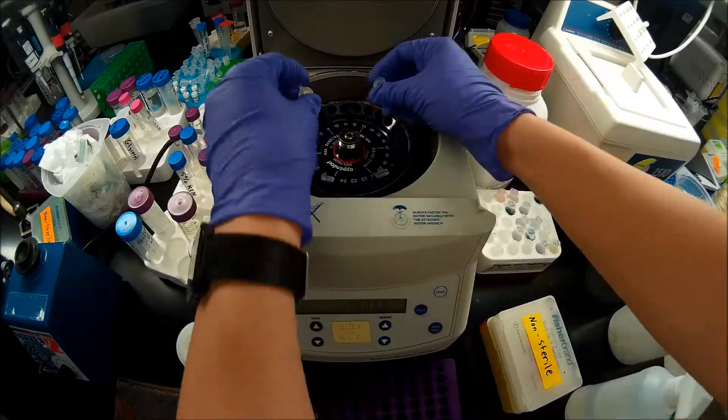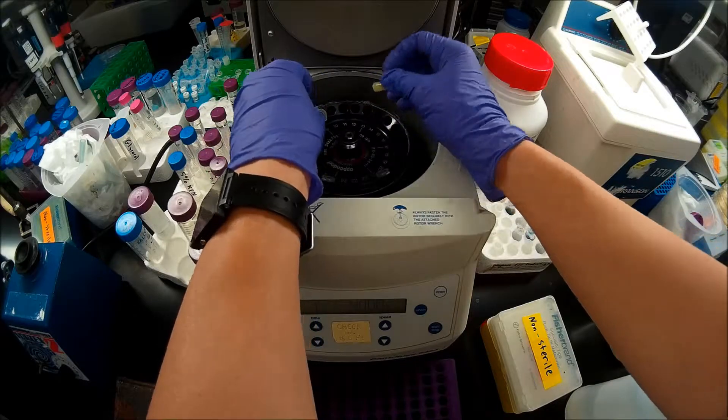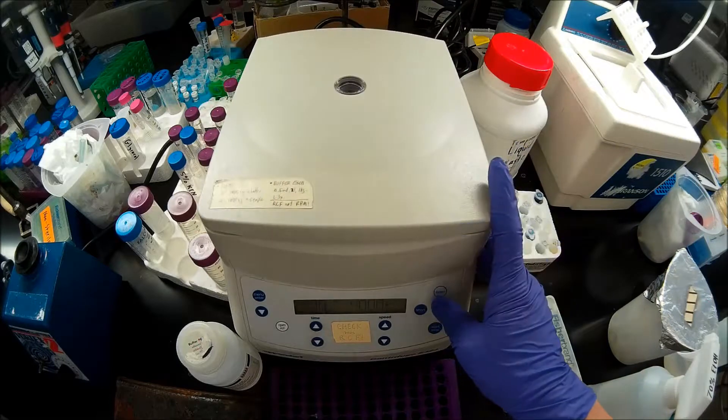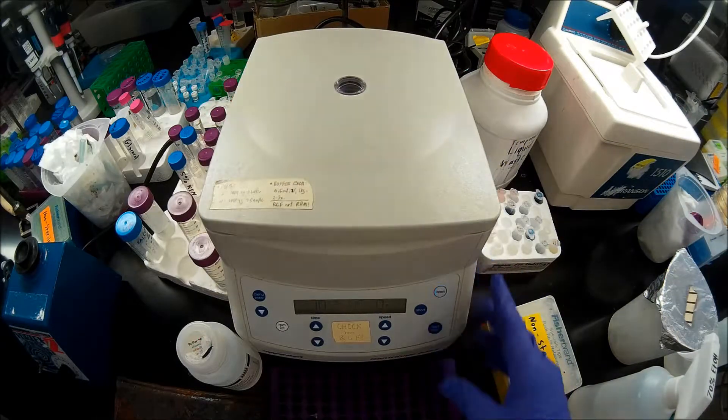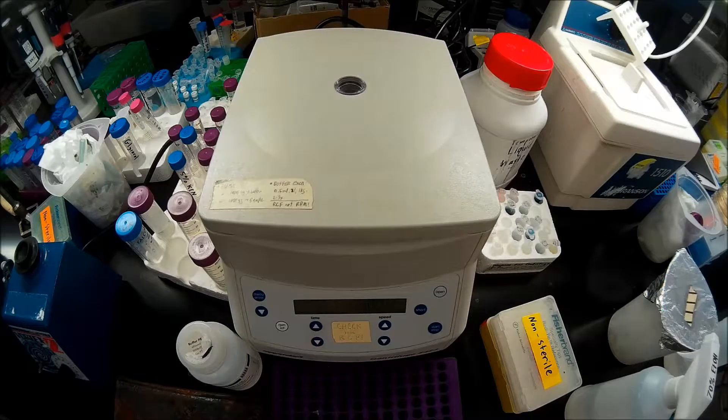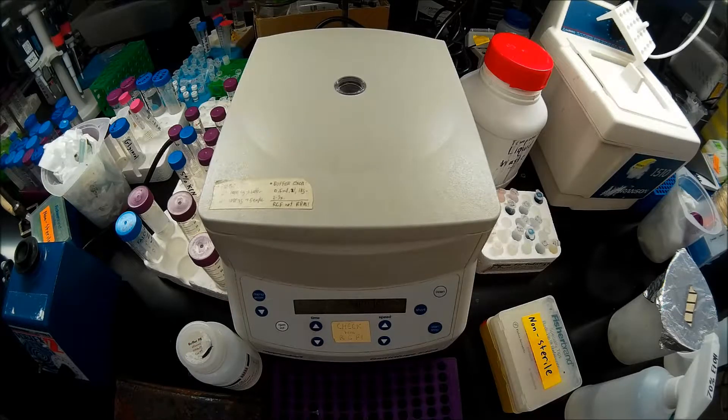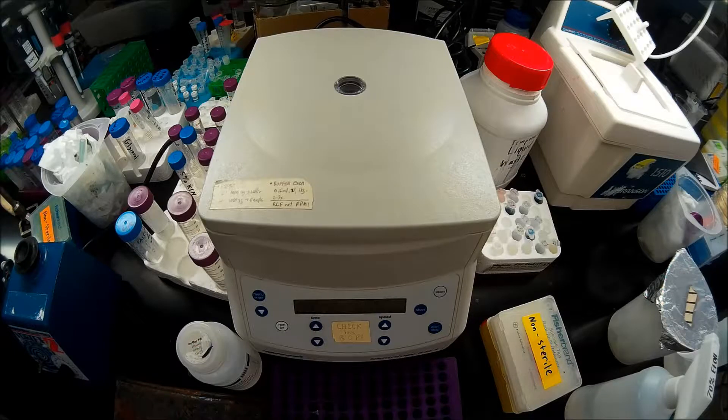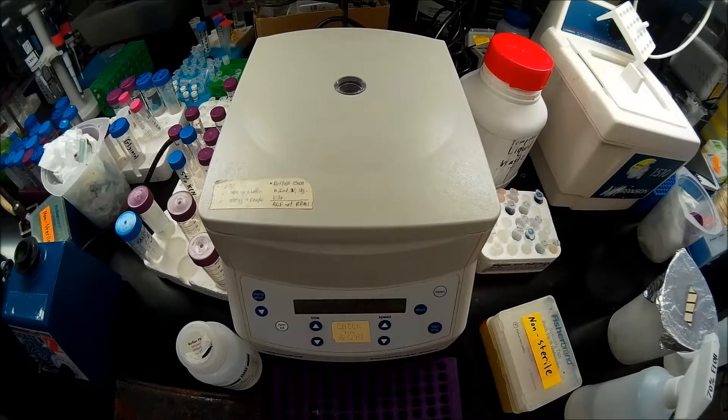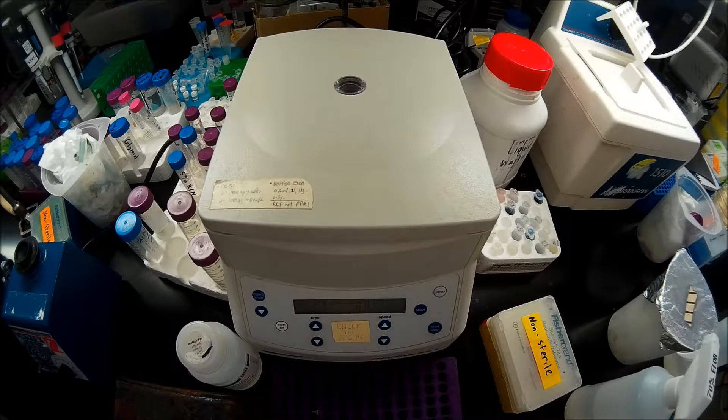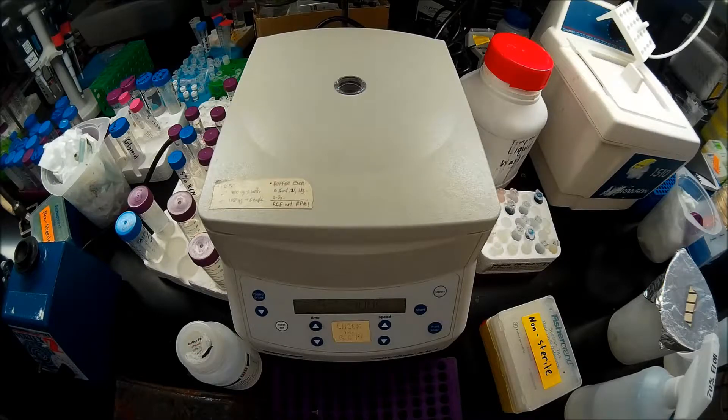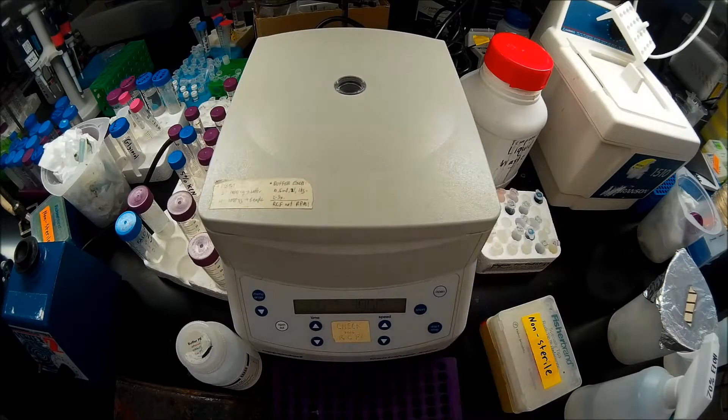So I'm going to spin these down just as I would for a DNA cleanup, which is basically what we're doing now at 4000 rcf for about 15 seconds. That should do it.